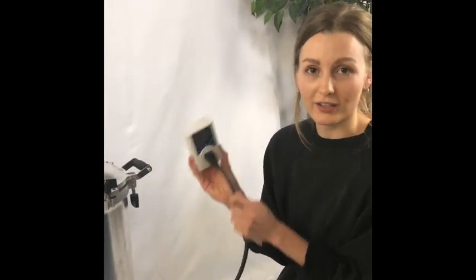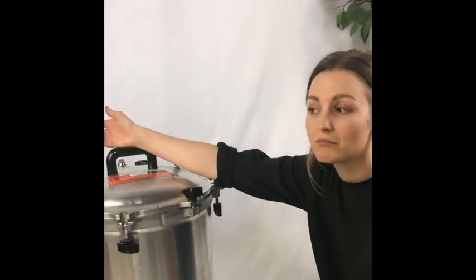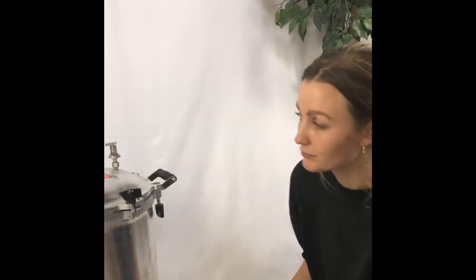If you're using this brand of timer in particular, make sure you've pressed confirm and see this light on, because you want this to be activated — it's the interface between your electricity and the autoclave. These are awesome because you can just walk away or leave. The whole process can take up to five hours, and it is important to keep an eye on your gauge. For things like liquid culture using honey, it can caramelize if you wait too long. If you see the needle get into the caution zone, that's not necessarily bad, but it can overcook organic materials like rice or honey. For sterilizing metal tools, no big deal. Just be vigilant for some things.